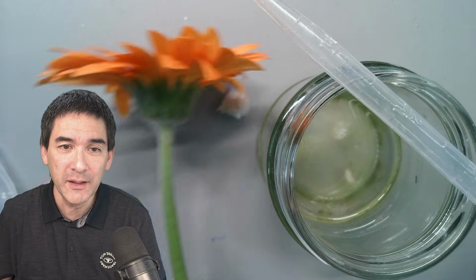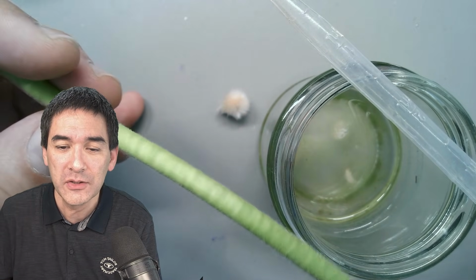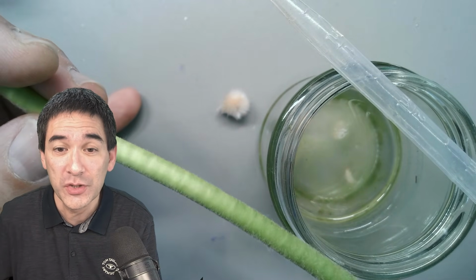The second thing is, I received a few days ago a whole bunch of flowers because some of my students graduated, and as a little present, because I was their teacher, I received a whole flower bouquet. I know that flowers will sooner or later all start to wilt. But I said, well, I'm going to put them under the microscope so those flowers at least are preserved virtually online on YouTube for all eternity. So I'm going to put this flower under the microscope, and specifically I would like to make again a couple of stem cross sections using my microtome. Maybe we're also going to put some other flower parts as well.